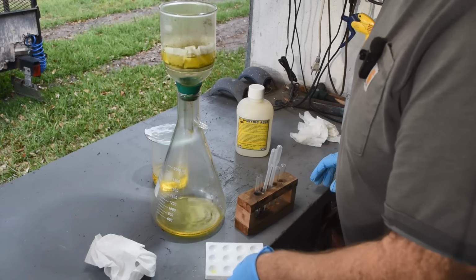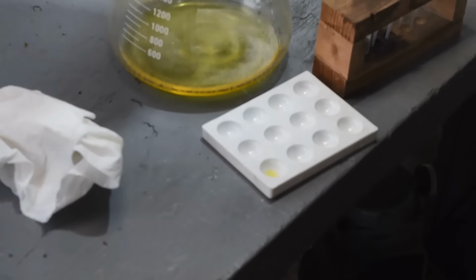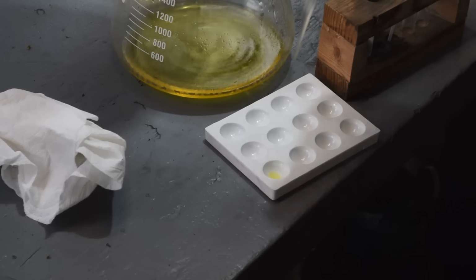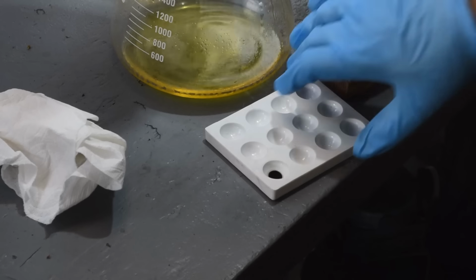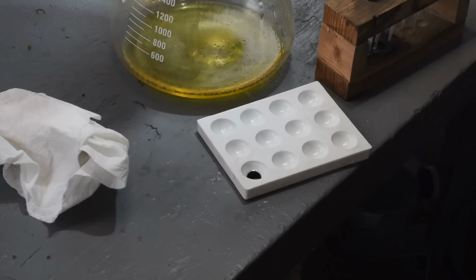Let's do a stannous chloride test. I will zoom in on the spot plate. I'll put a drop of stannous chloride on it and see what we got. Boom! Oh yeah. Look at that. Look at that. Yes, we have gold. And that is a really strong indication for gold, as it should be.